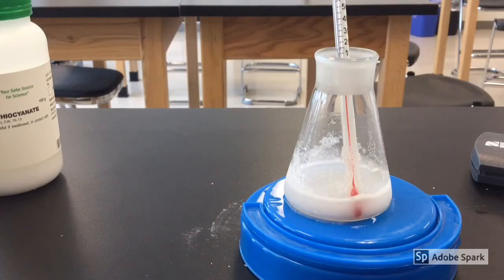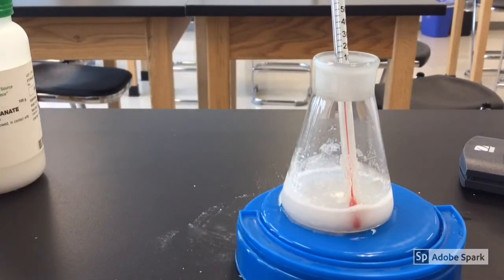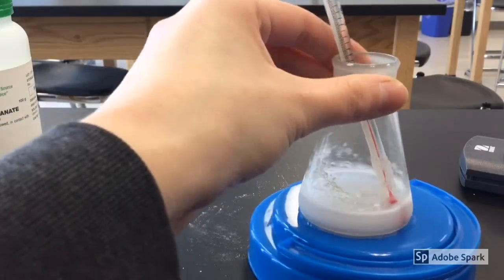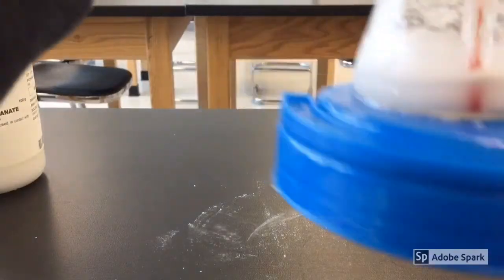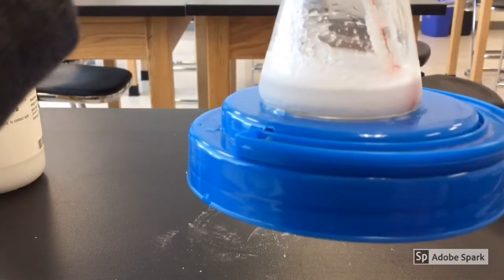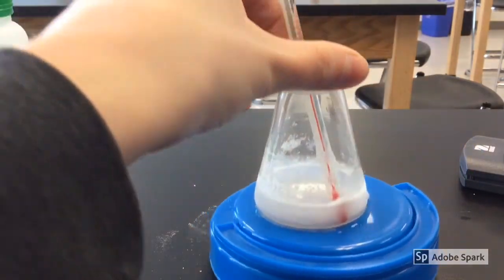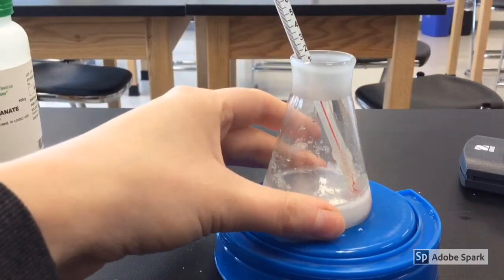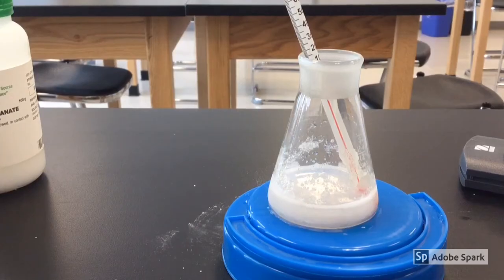So as we know, it's super cold. Only a couple of minutes have passed. Remember how I put water on this plastic? There's a reason I did that. Look — it froze the water! If you look closely, you'll see there are ice crystals — the water has totally crystallized. This is what we call an endothermic reaction, so it is losing a lot of heat and it's really, really cold. So there you go — Cool Reaction. Pretty cool.